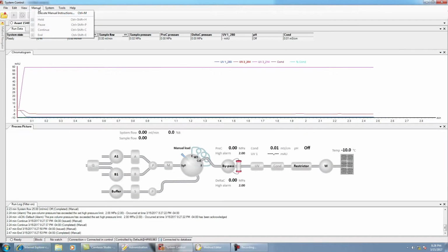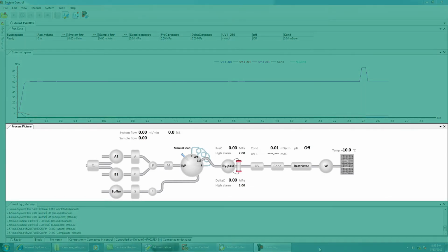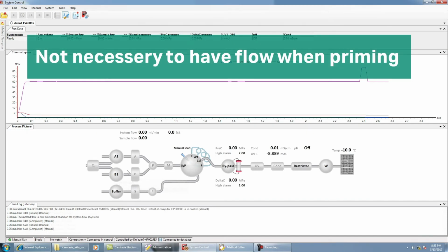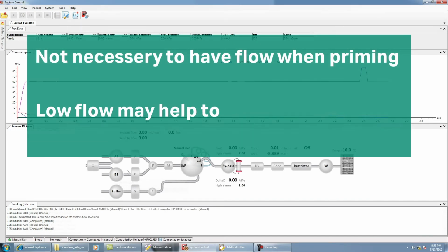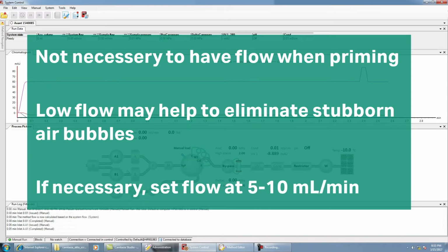In UNICORN, select the buffer inlet line you want to prime from the flow path in the manual commands or from the process picture in the system control window. It is not necessary to start a flow when priming the pumps, but it may help to remove stubborn air bubbles trapped in the pump heads. If desired, set a flow rate of 5 to 10 milliliters per minute after selecting the buffer line, and start the pump running.